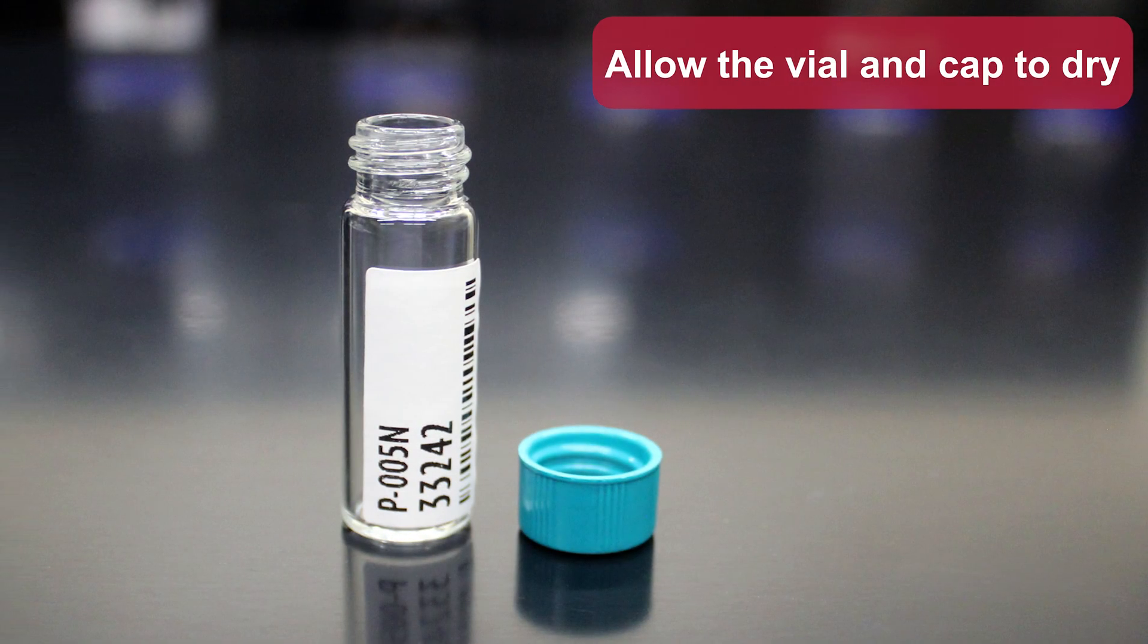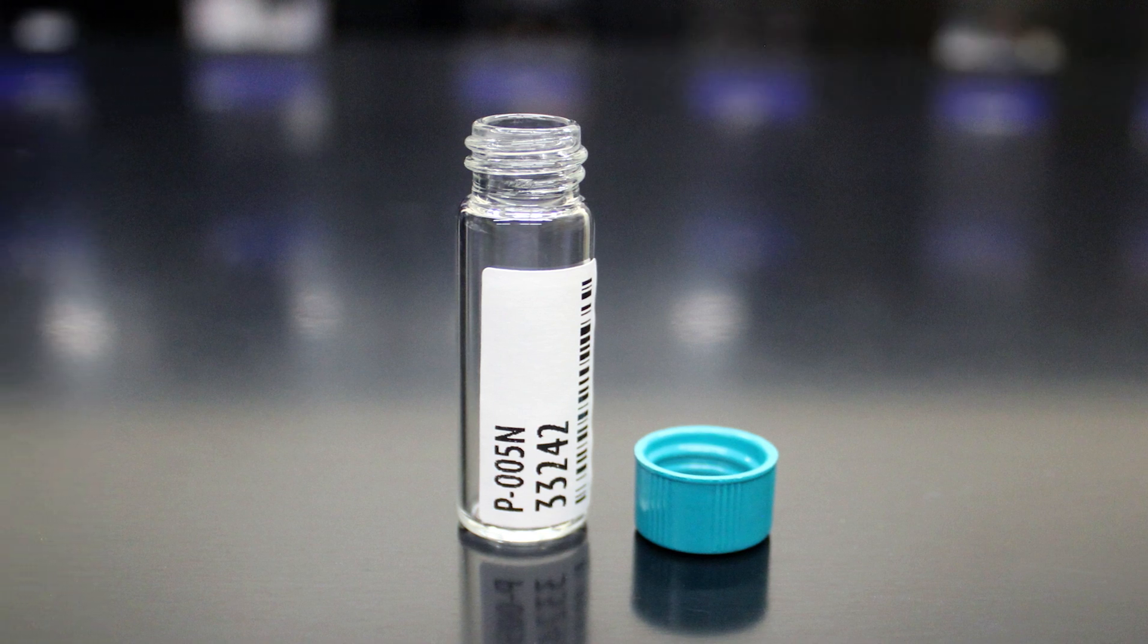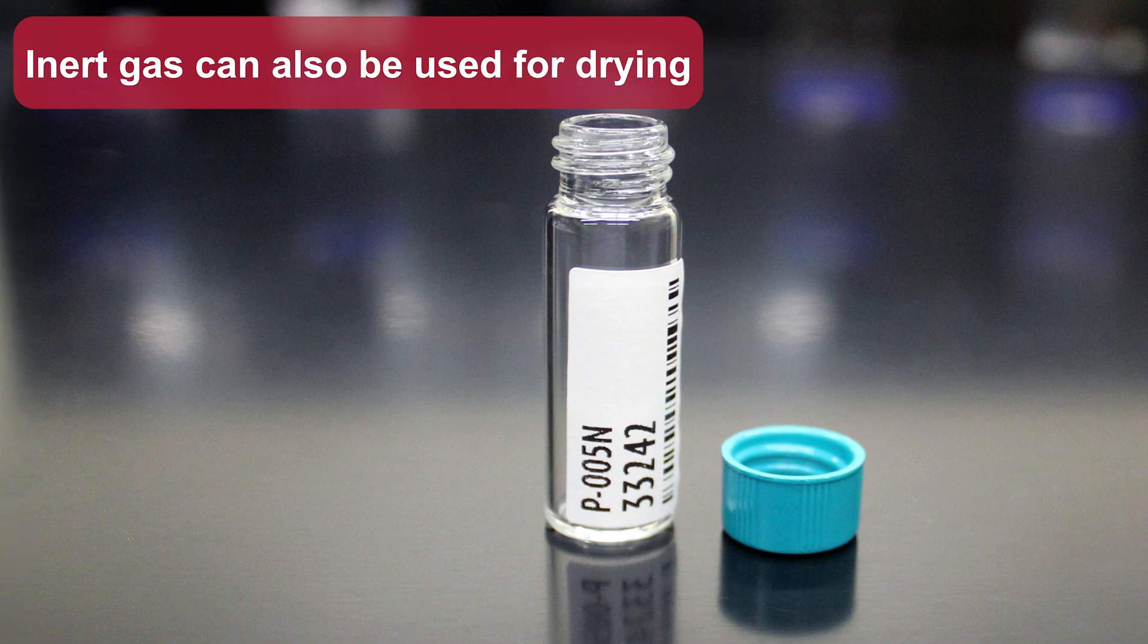Allow the vial and cap to dry. Inert gas can also be used for drying.